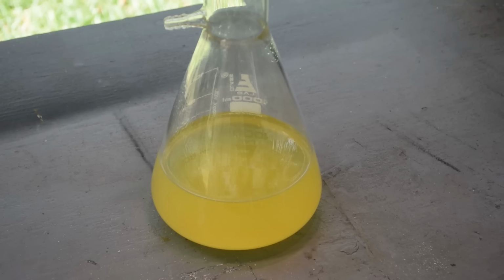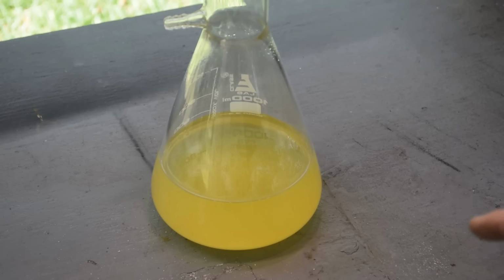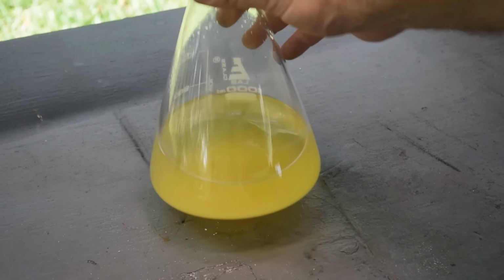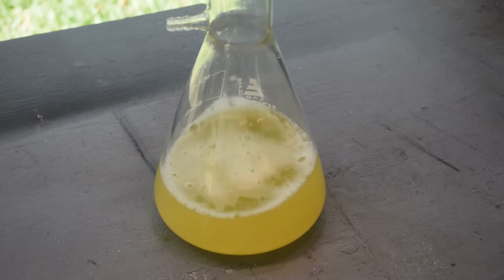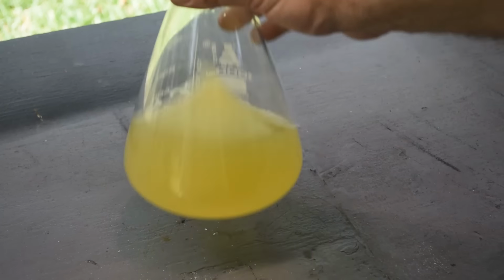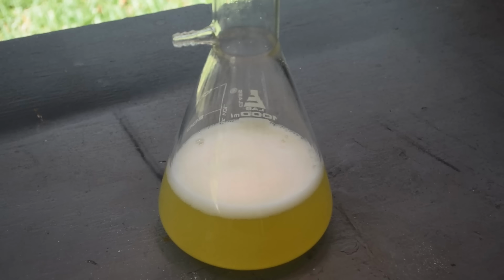Well, as for this stuff, as you can see, it has gone back into solution. I put a couple more milliliters of nitric acid in there, and I put it on low heat. It's just warm, but it all went back into solution. It's still foamy. Where is all this foam coming from? I don't get it.